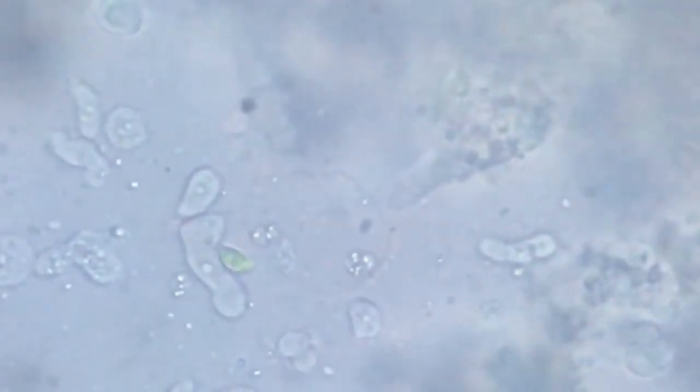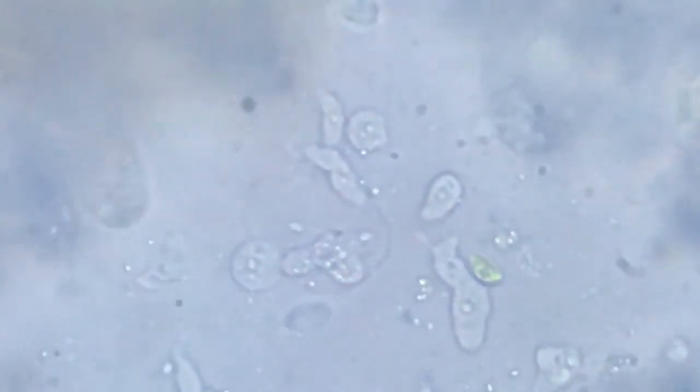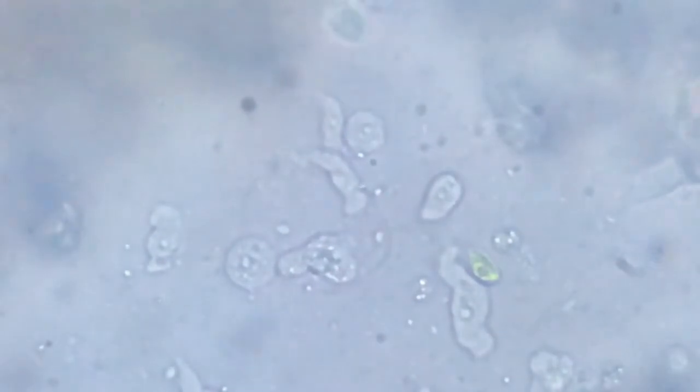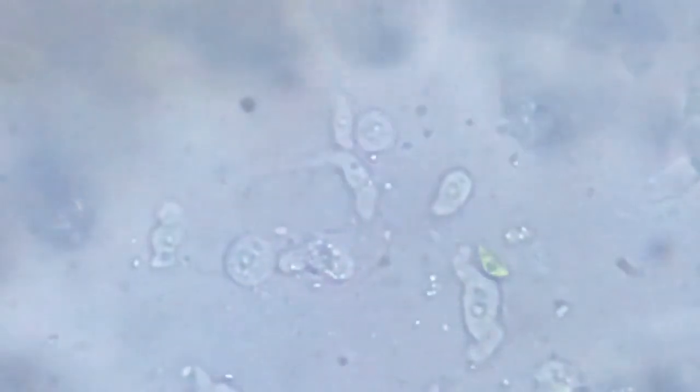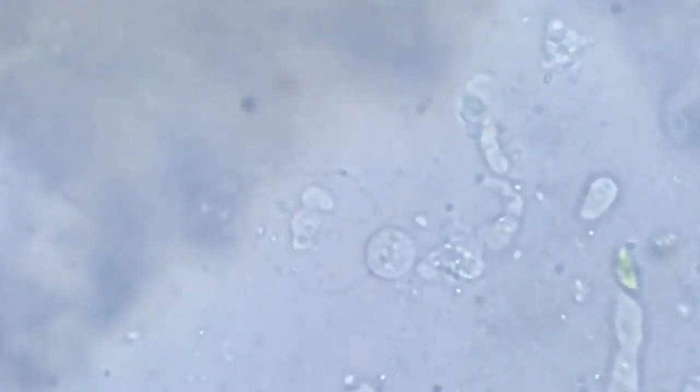This one is probably not interested in eating any algae when you have a better, less energy consuming food available in the form of decaying larva. So we go back and search the tip. Oh my, amoeba everywhere. It's a colony of amoeba.